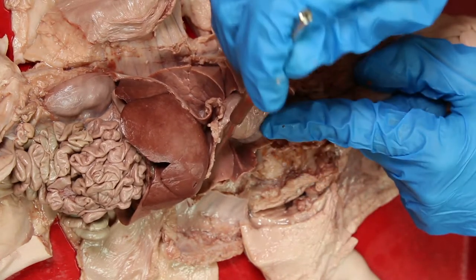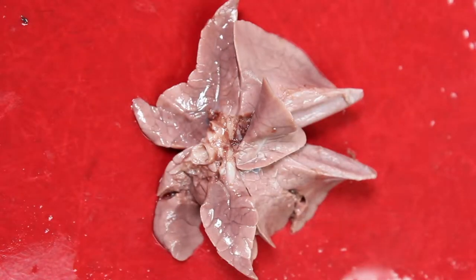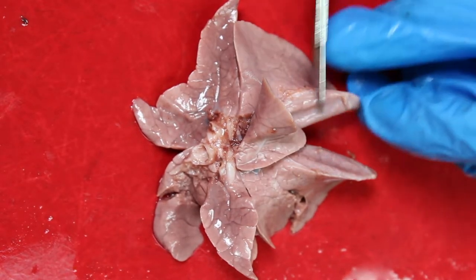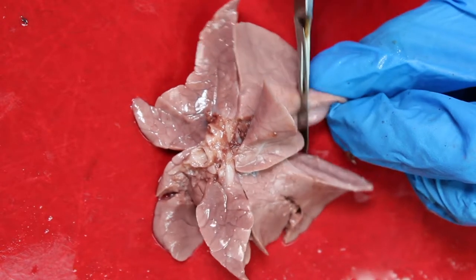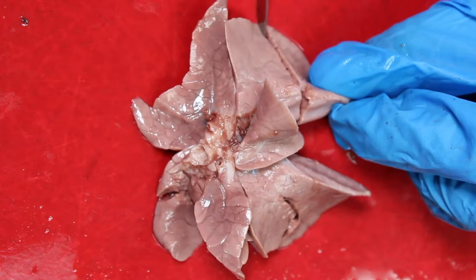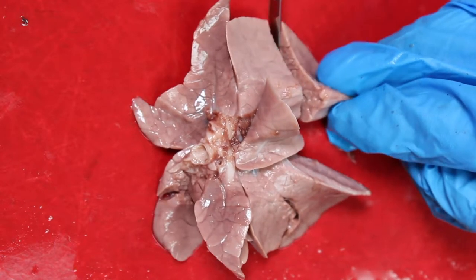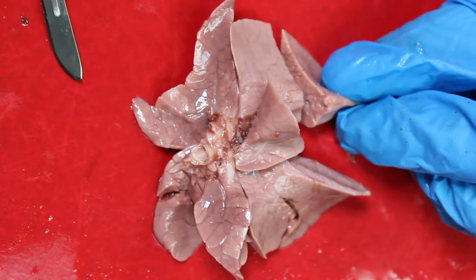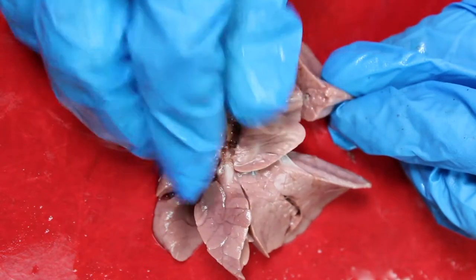The lungs are part of the lower respiratory tract and accommodate the bronchial airways when they branch from the trachea. The lungs include the bronchial airways that terminate in the alveoli, the lung tissue in between, veins, arteries, nerves, and lymphatic vessels.